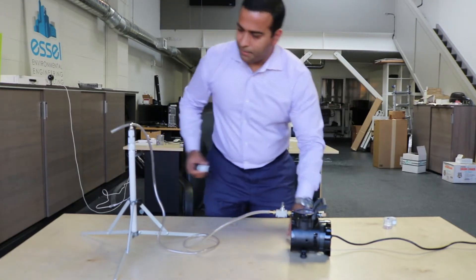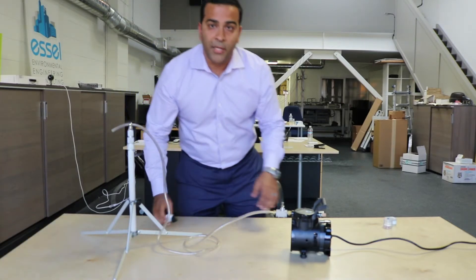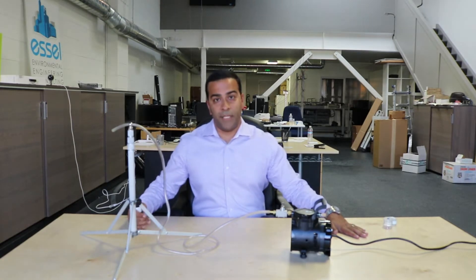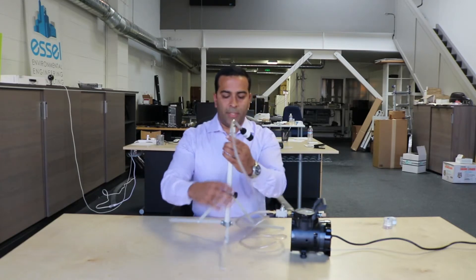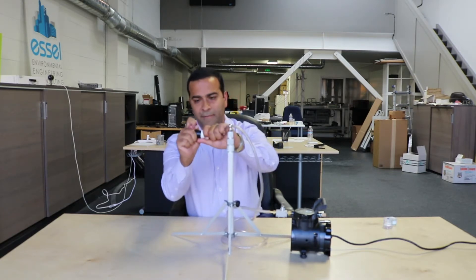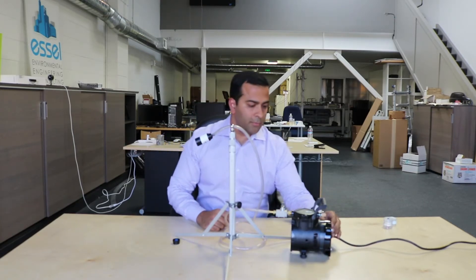Here's how it works. You hook this up, and there's a rotometer — which is what this looks like — and the rotometer is used to make sure the flow rate in the pump is known when you start and when you finish. You hook up the pump like this; this is the cassette, so it kind of has this look to it. You want it down at a 45-degree angle, and you obviously want to take the front off so it looks like this.